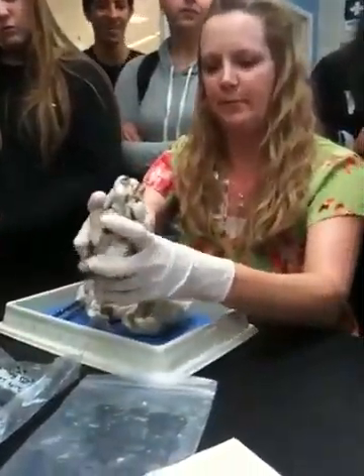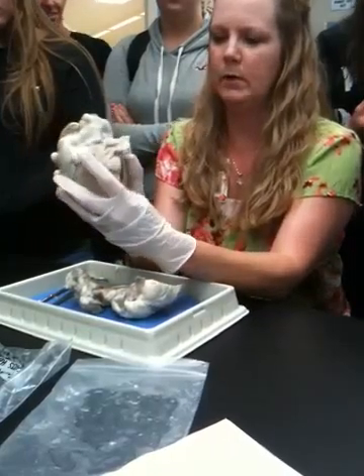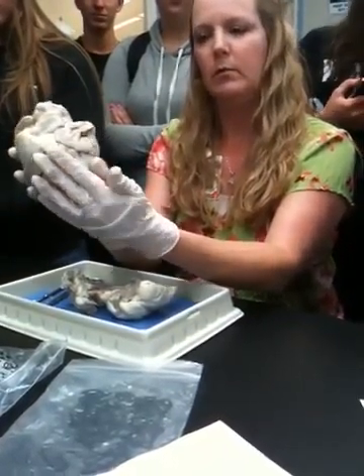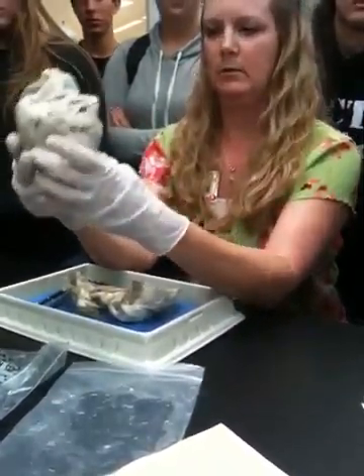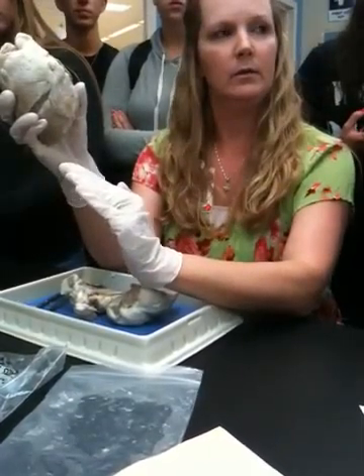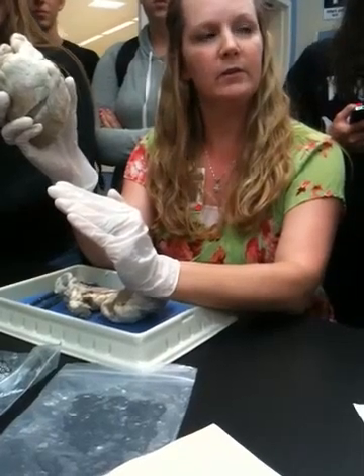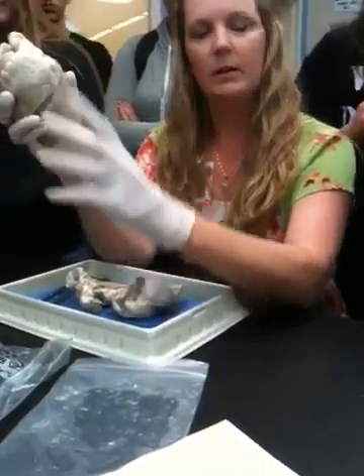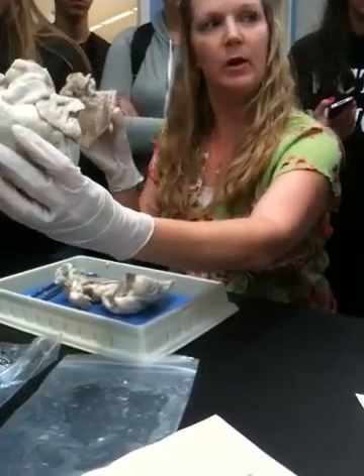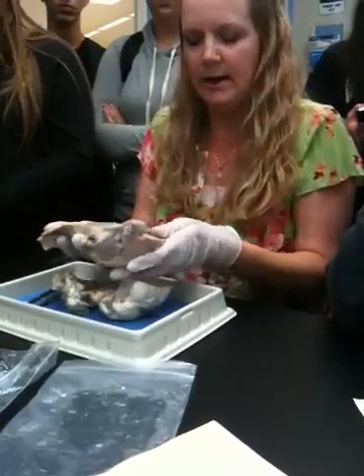Section. Okay. I know that when you're looking at the ventral view, everything's the opposite, but when you cut it open, does that mean it's the right way? Wait, what are you talking about? Like, when you're just looking at it, the ventral view, everything's the opposite, so your left is on the right. Right. Correct. But when you cut it open and you start answering questions, you go, this is the ventral part, and this is the dorsal part. So the left is on the left. Does that mean that when you're looking at it this way, left is left?